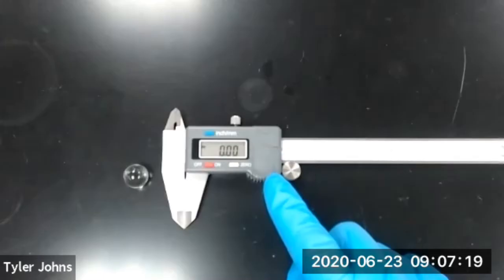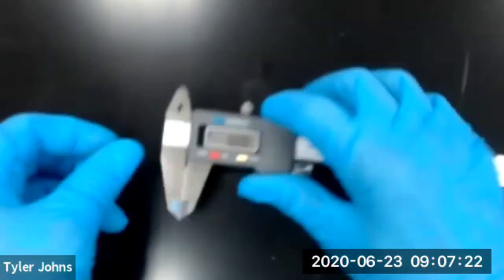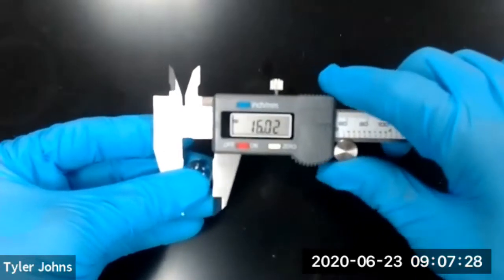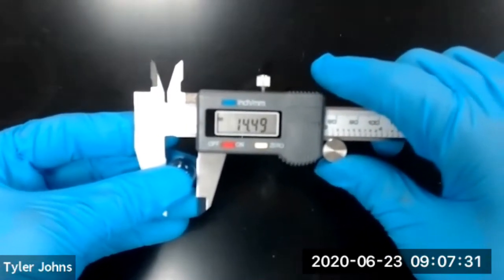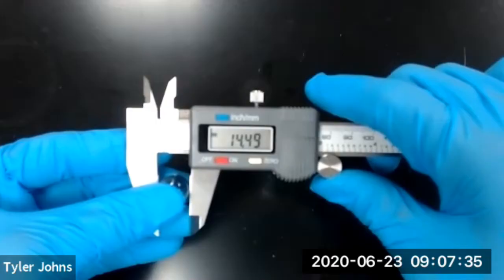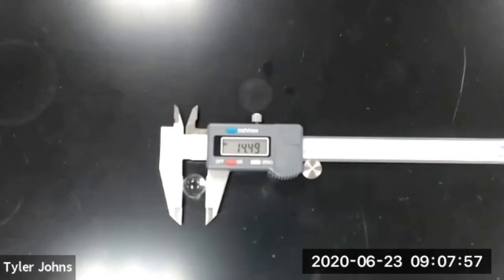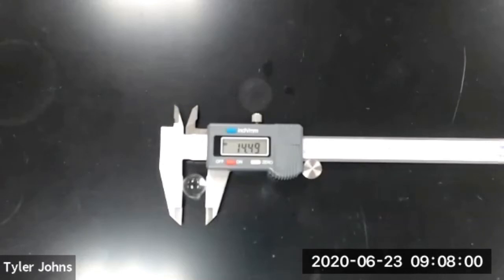We next need to use our digital calipers to determine the diameter of a marble. The diameter of our marble is 14.49 millimeters. You now need to use the formula for the volume of a sphere to determine the volume of our marble.